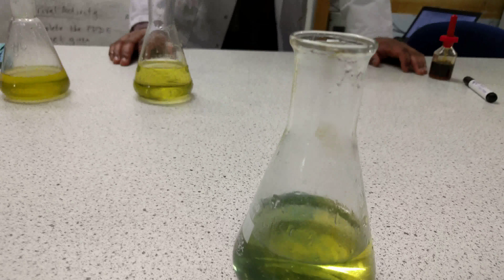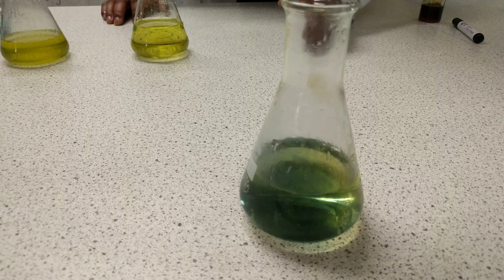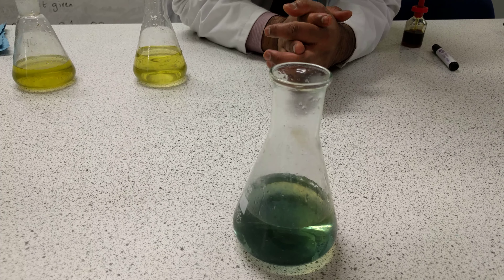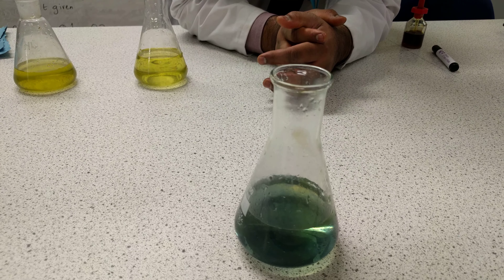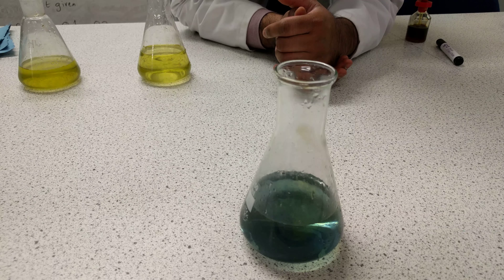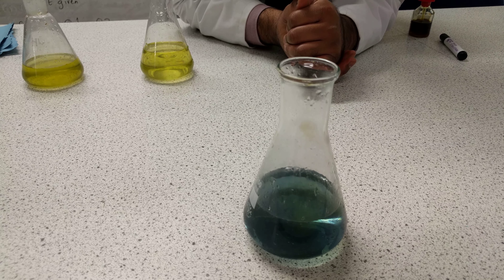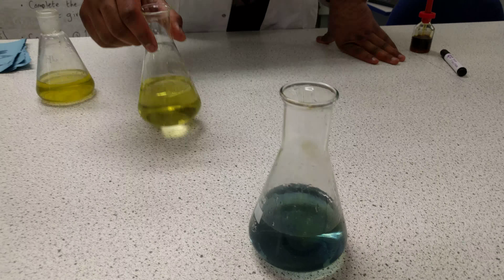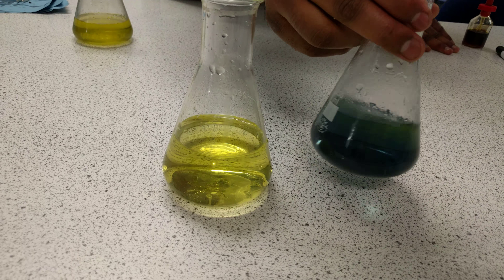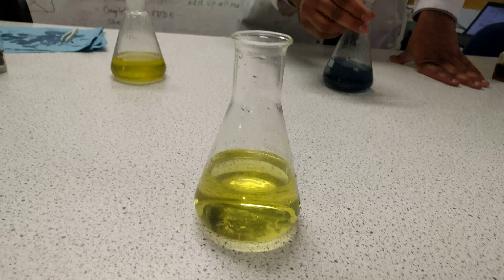The universal indicator is starting to turn a bluish-green color and you can see a lot of fizzing. If you look very closely, you can see gas coming off at the top — that gas is hydrogen. That's why we call it an alkali metal: it reacts with water, forms a metal hydroxide which is an alkali, and the bubbling releases hydrogen gas. A clear color change from neutral to a bluish color, meaning it's now alkali. We've got lithium hydroxide in the water, therefore it's called alkali.